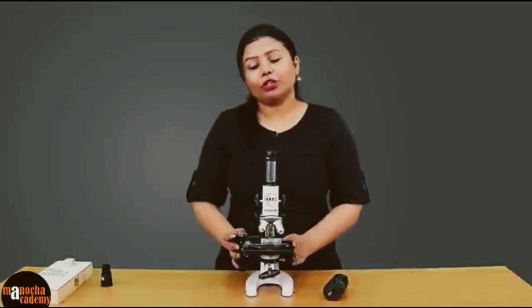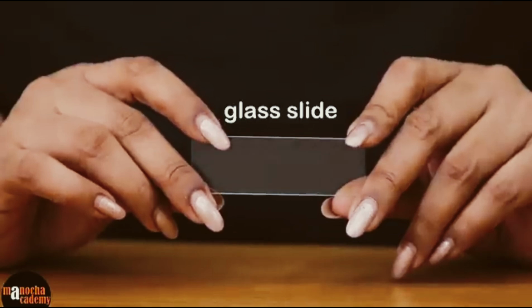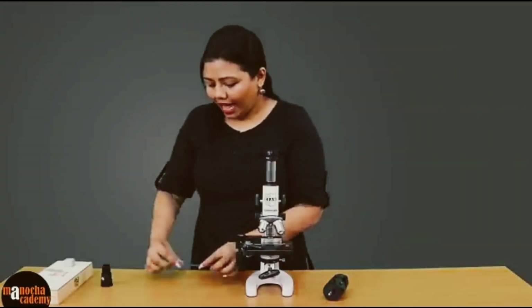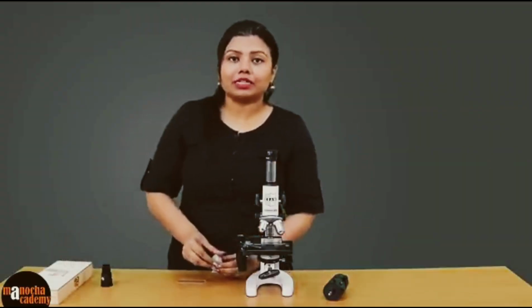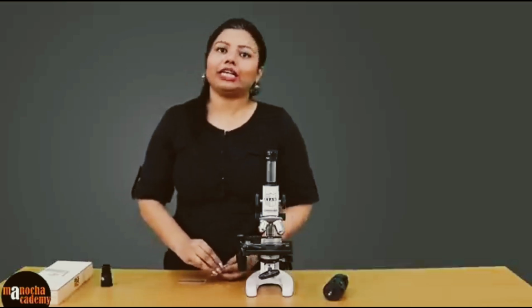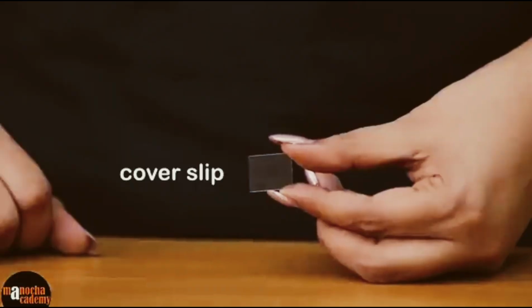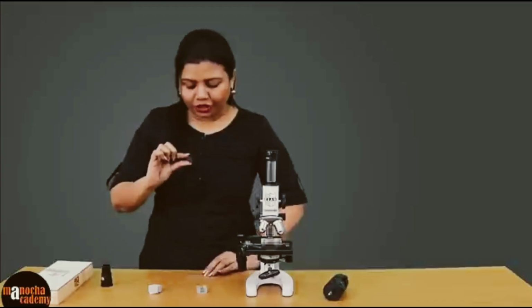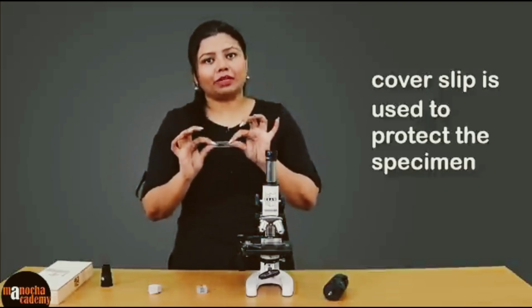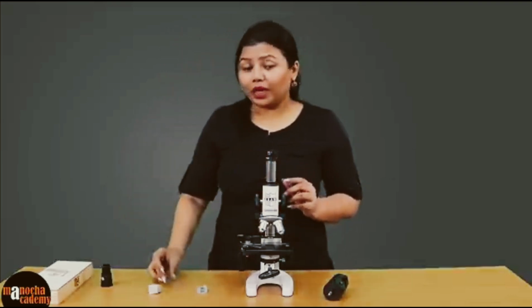Now we will show you a slide. So this is a glass slide on which generally we put a specimen which we need to observe under the microscope, and so that your specimen does not fly away, does not dry out, and is not damaged, we usually cover the specimen with a cover slip. You can see this is an absolutely fine piece of glass which we use to cover and save the specimen from being damaged. Now once you have prepared your slide, sometimes we have prepared slides.